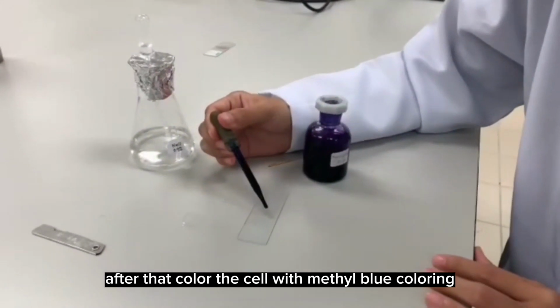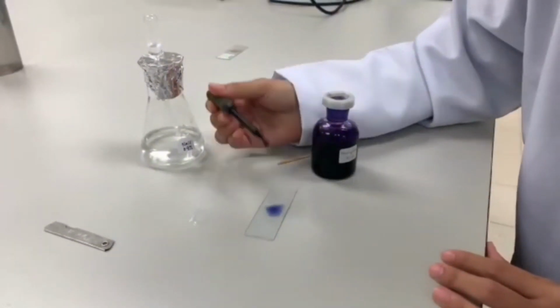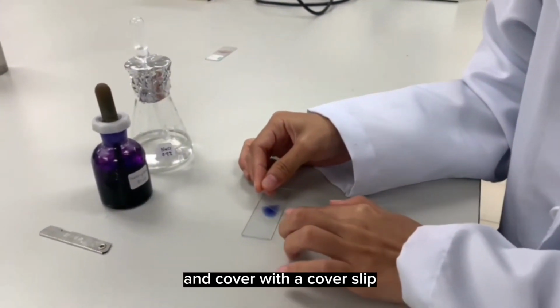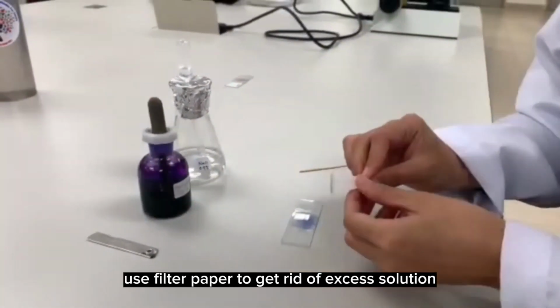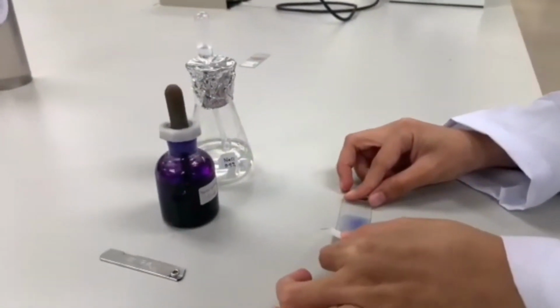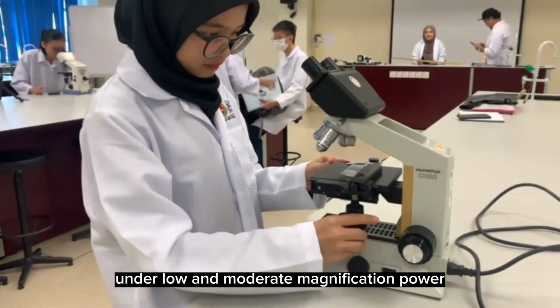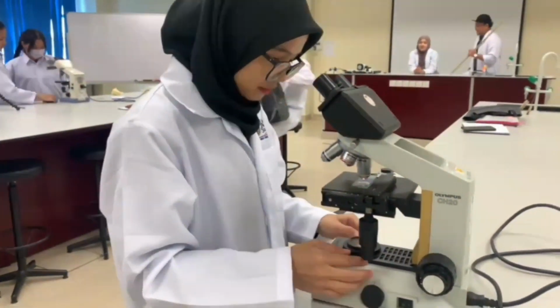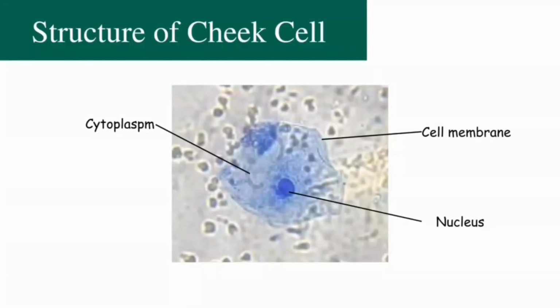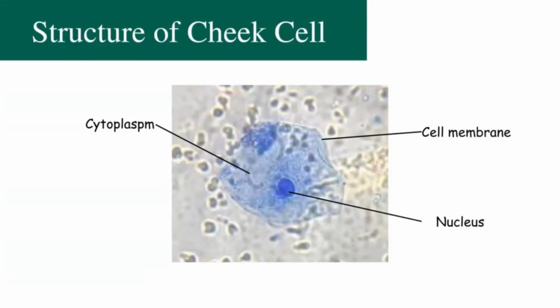After that, color the cell with methylene blue coloring and cover with the cover slip. Use filter paper to get rid of excess solution. Lastly, observe the cells under low and moderate magnification power. And this is the structure of the cheek cell.